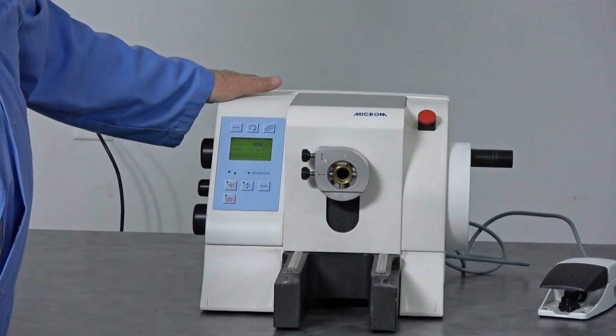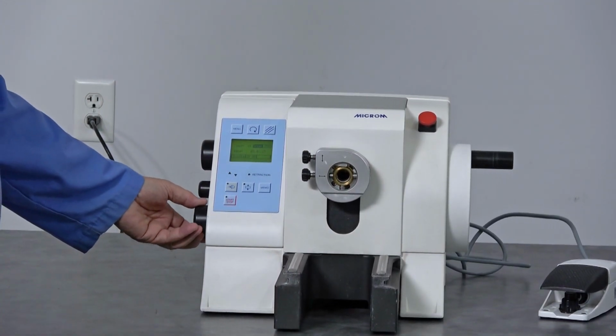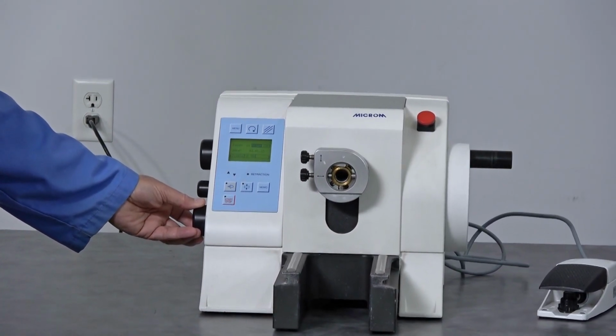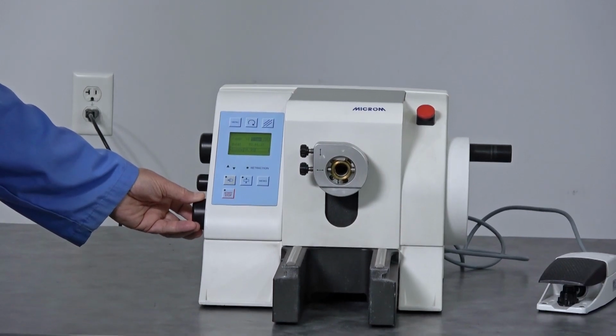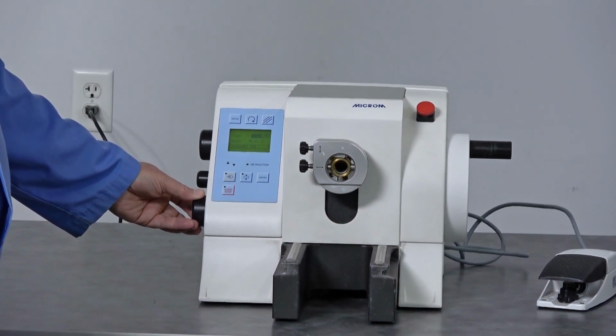Anyway, this unit, everything else works great on it. We have the ability to move the head out, which is what it's doing now, and back in. If we restart it, it'll go ahead and bring it back in.